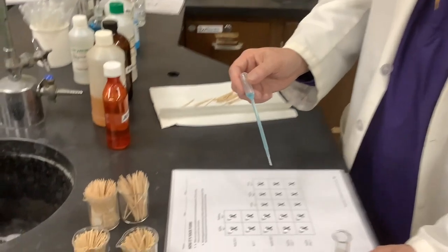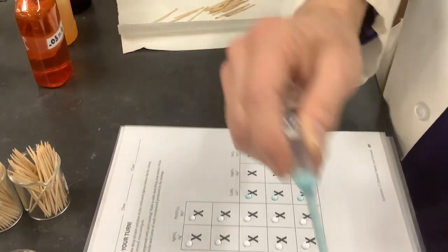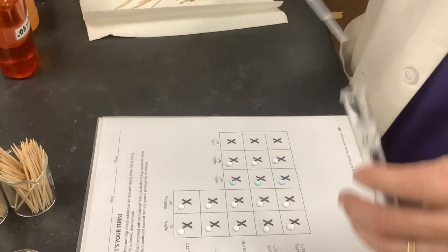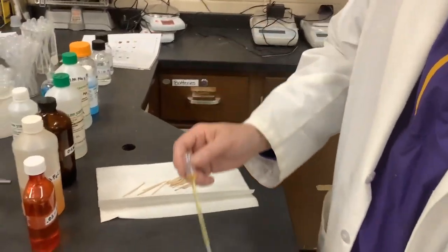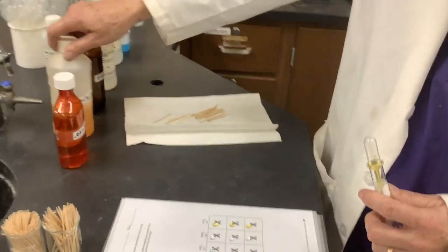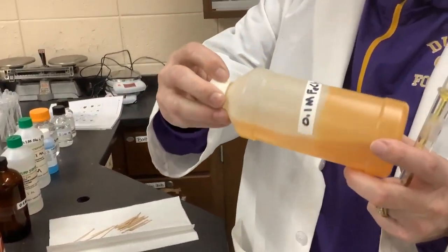We'll learn about the solubility of different substances — silver compounds and lead compounds are not known for being particularly soluble. The next one is lead nitrate. I'm going to put a drop of lead nitrate, and because I'm handling lead compounds I'm going to wash my hands when I'm done. Next is copper sulfate — you can see the blue tint from the copper(II) ions. And then magnesium sulfate, also known as Epsom salt.